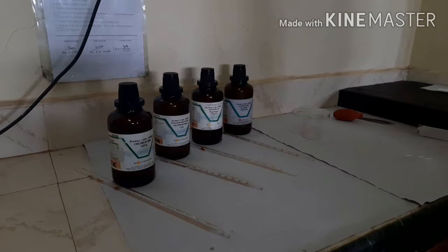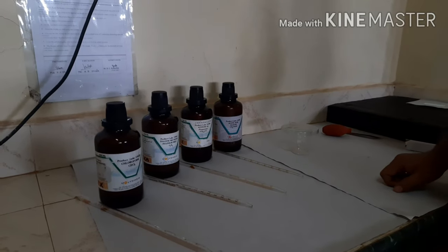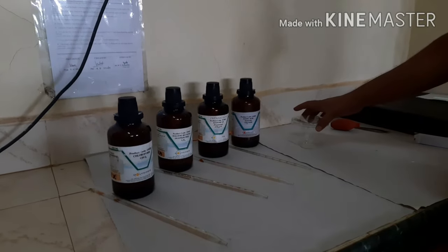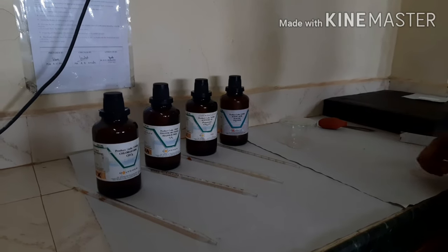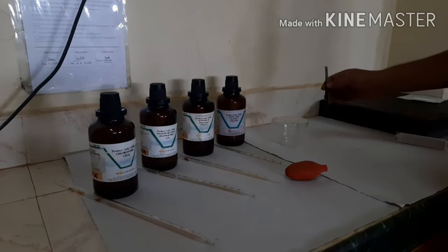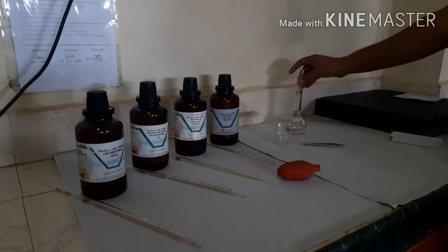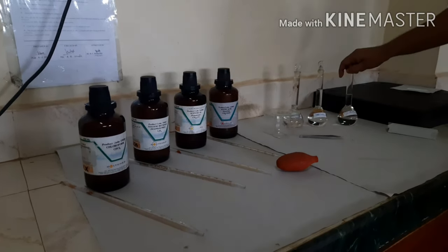Now for the experimental setup: the first step is to prepare the mobile phase, which is a mixture of chloroform, toluene, acetone, and glacial acetic acid. We have dedicated pipettes for each solvent. Our developing chamber is a simple 100 ml beaker covered with a petri plate as a lid. We use a rubber bulb for pipetting, forceps for handling the plate, capillaries for spotting, and we have our samples: diclofenac sodium, aspirin, and paracetamol.